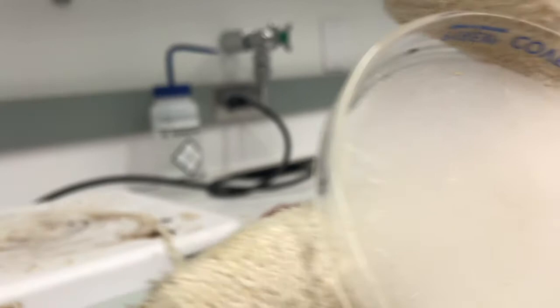If you don't have a glass petri dish, you can use two nested beakers that will look like this.